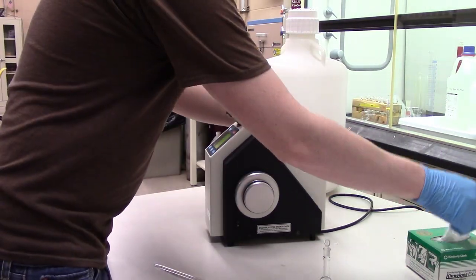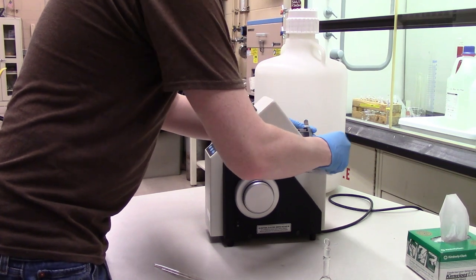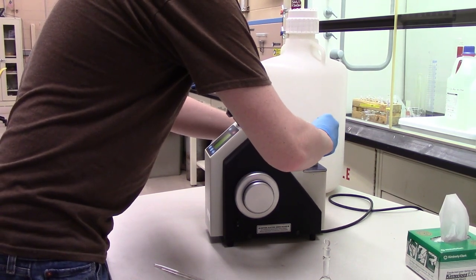Lastly, flip open the prism and wipe it down with a dry Kim wipe. The prism will need to be cleaned like this after every sample you analyze.